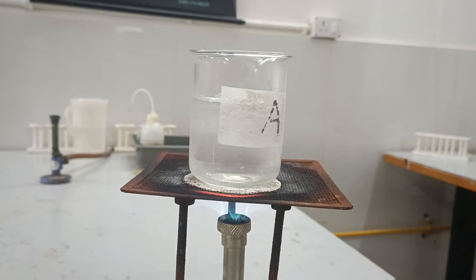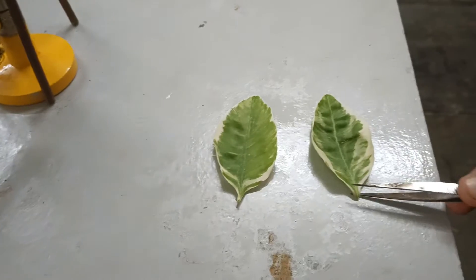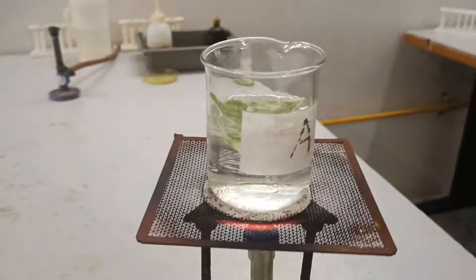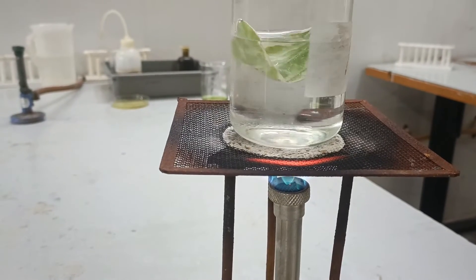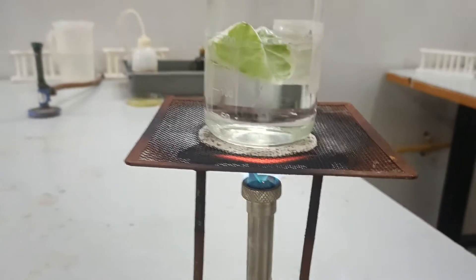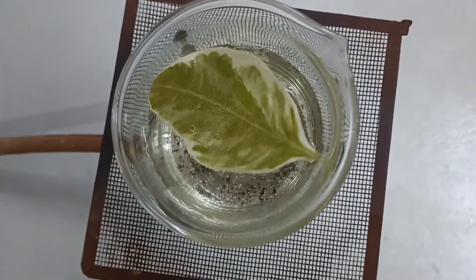Let's boil some water over the Bunsen burner in a beaker. Let's take the Pedilanthus leaf and immerse it fully into the boiling water. Please make sure that the leaf is completely immersed inside the boiling water.